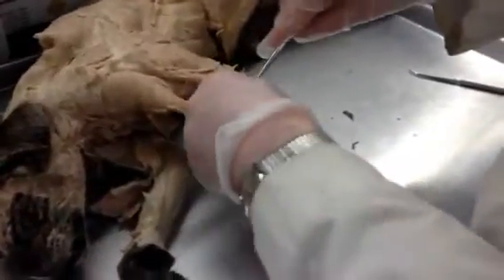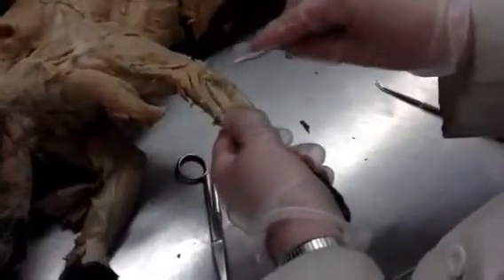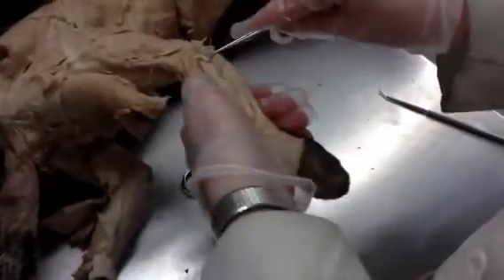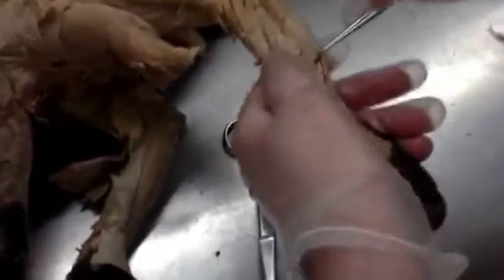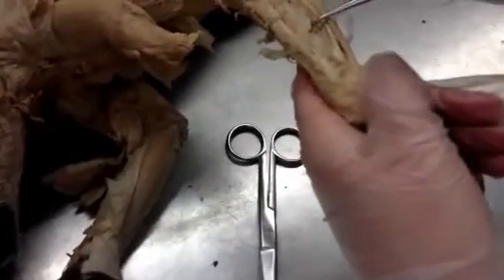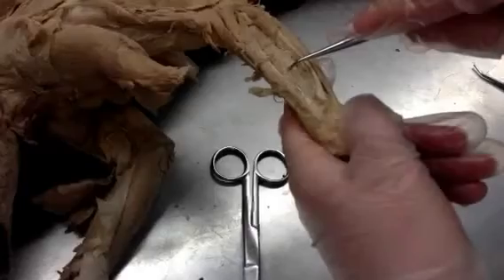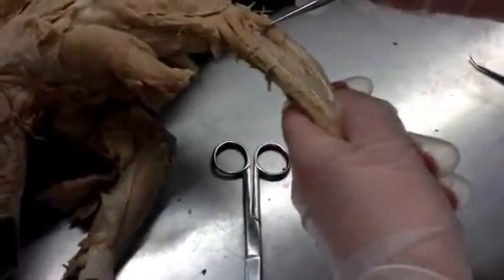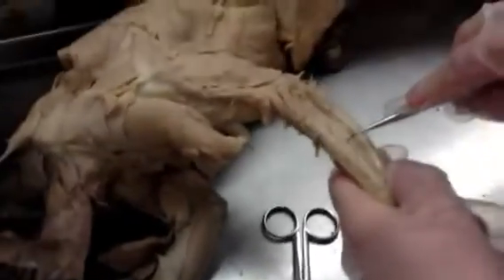Now we're going to separate the muscles and look for the deep ones underneath. The muscle on the upper third of the radius is called the supinator — this is the supinator. It's a deep muscle on the upper part of the radius, the upper third, and there's a split — there's the bone there. On the lower two-thirds of the radius going towards the wrist is the extensor pollicis brevis. So if I show you a deep muscle closer to the elbow joint, that's the supinator; if I show you one closer to the wrist, it's the extensor pollicis brevis.